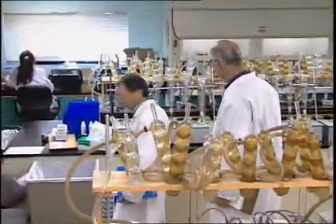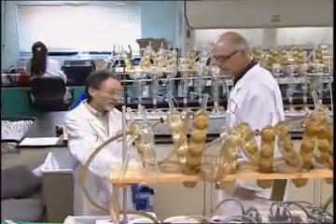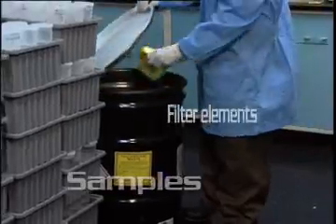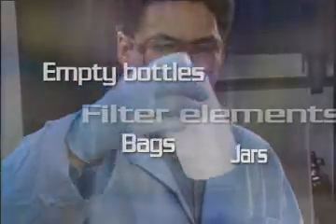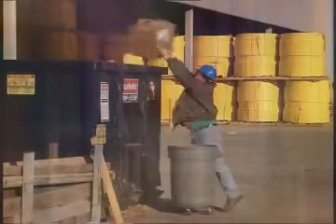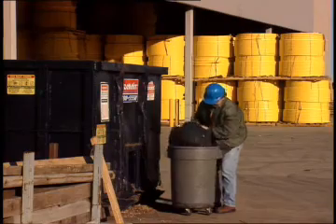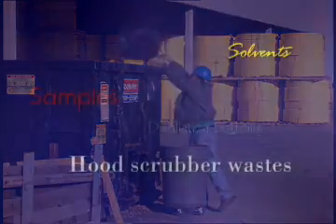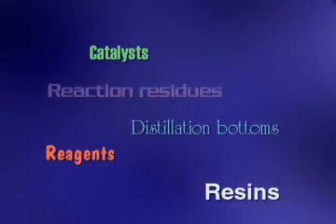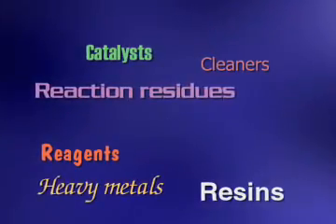Consider the wastes generated at a typical lab. Samples, both used and excess. Filter elements, empty bottles, bags and jars. Spent reagents, waste gels, broken glassware. Waste paper, plastic, and packaging. Most of these wastes can be disposed of along with normal trash. Some lab wastes are hazardous wastes and can cause serious damage if released into the environment.